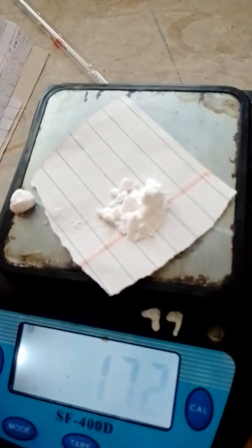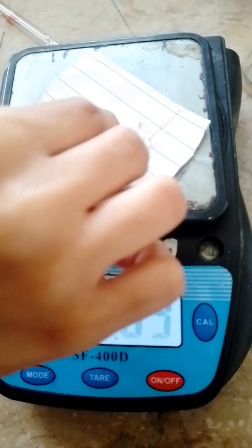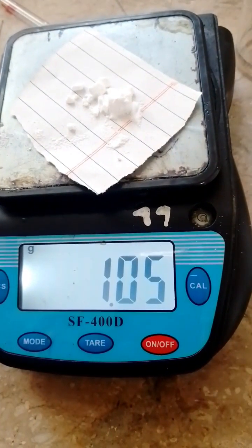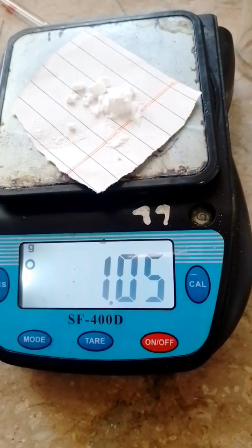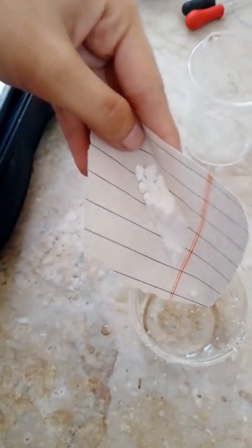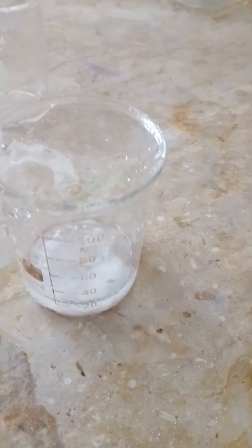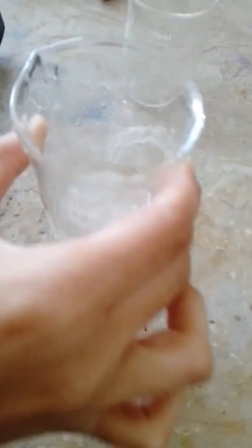After that, you will place the salt of sodium carbonate and weigh it of about 1.06 grams, as you calculated by the formula. And transfer the salt in a beaker, adding a small amount of distilled water and shaking it well.